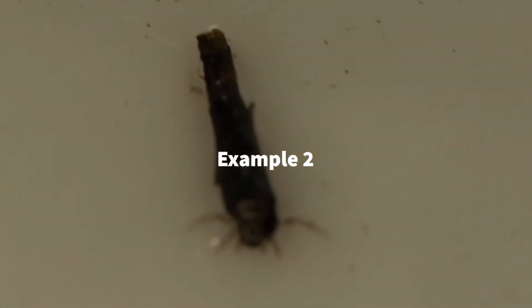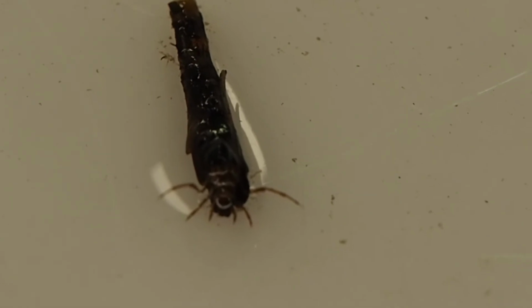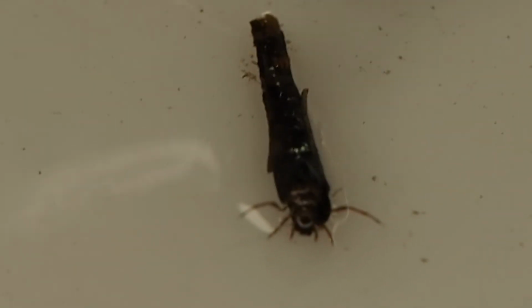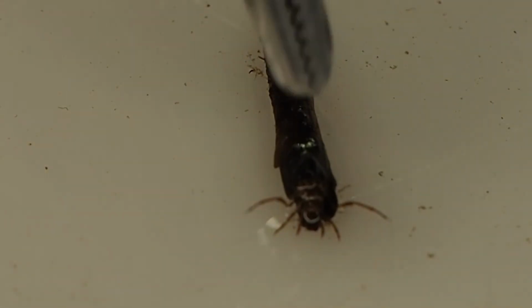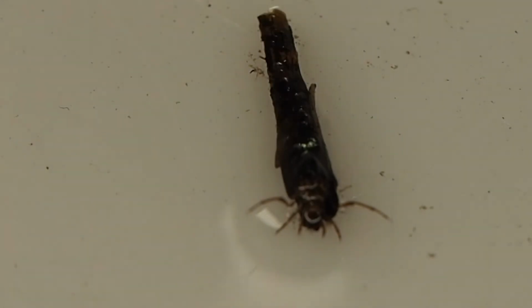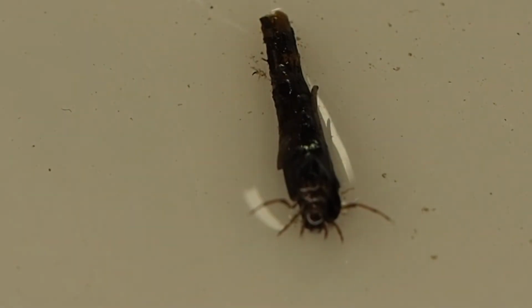Okay, so I've put another critter that I picked out of the microscope, and this is one of those ones we saw crawling around that were encased in this stick-like casing or cocoon. And what we can see in the image here is pretty much its entire body is covered with this stick casing, but its head and its legs are sticking out. And so you only get to see really the head features and those limbs. But that is enough to tell us a bit about where this species might come from.